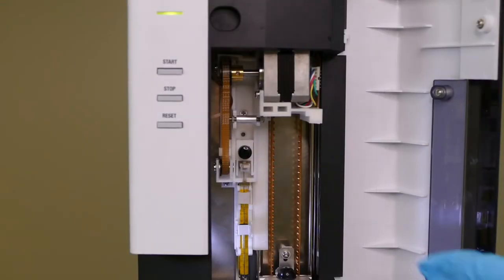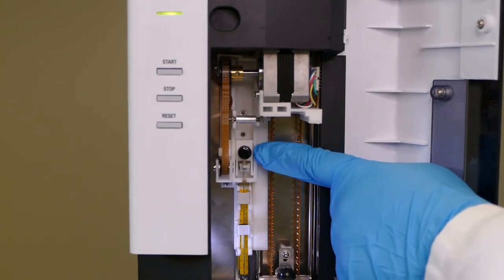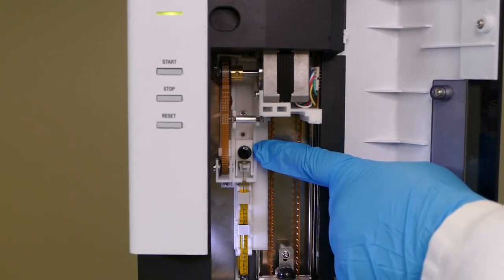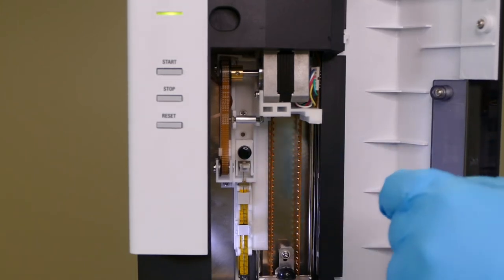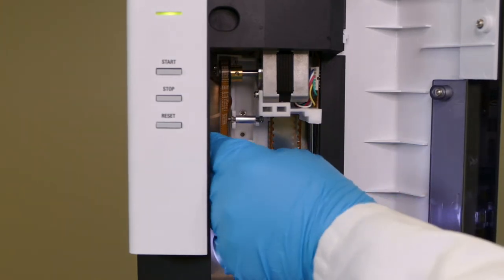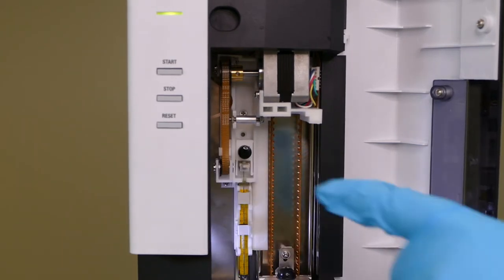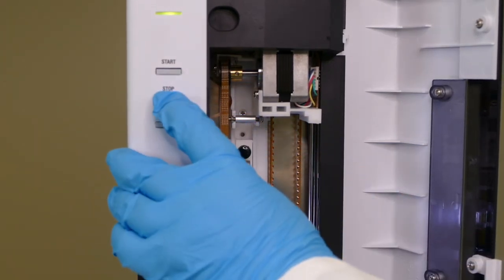The auto-injector status light turns to yellow for maintenance. To remove the syringe, the plunger holder must be released. By default, the motor for the plunger prevents any movement and must be released by pressing the stop button.